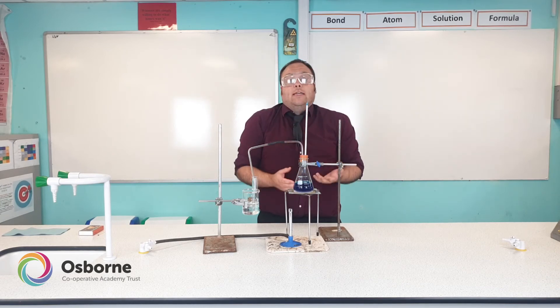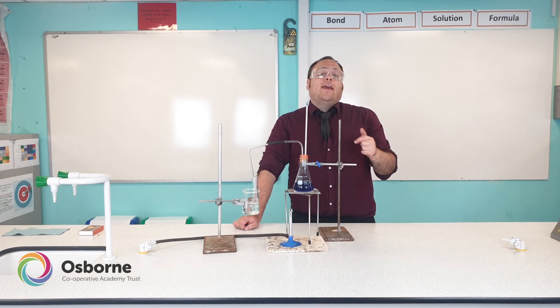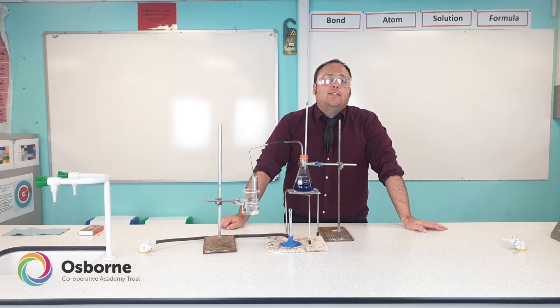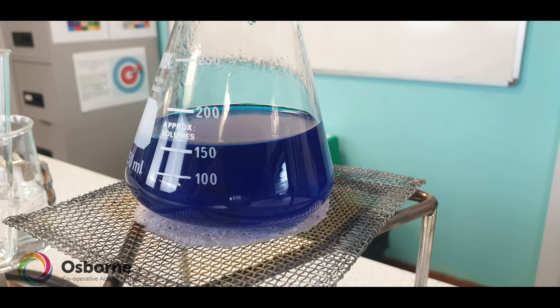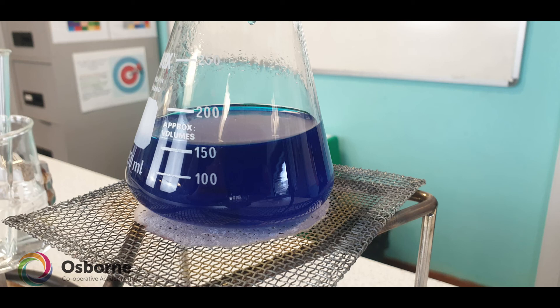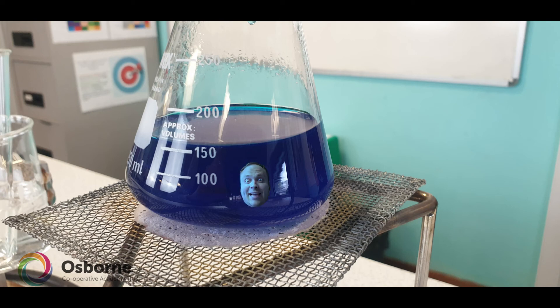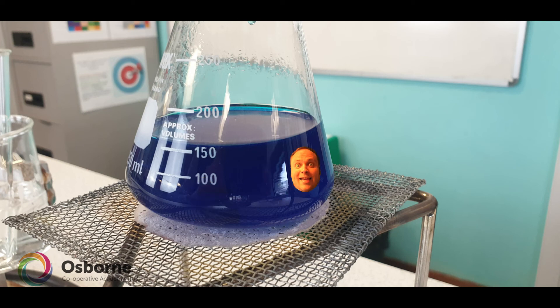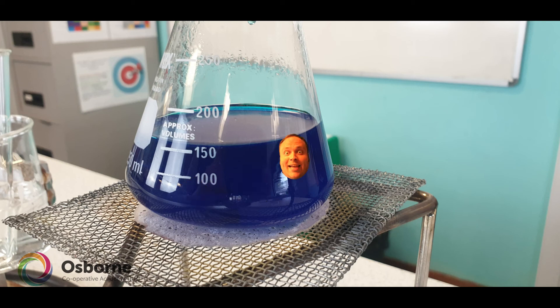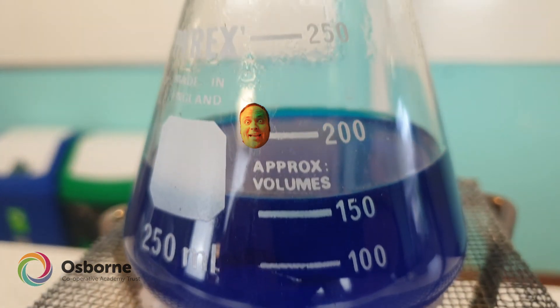Now you should know what distillation is and how to set up distillation using a Liebig condenser and also as part of the Core Practical. The final part is to know how distillation achieves this separation. Distillation uses the fact that different chemicals have different boiling points in order to separate them. In the case of ink and water, water has the lower boiling point, which is 100 degrees Celsius. Imagine you could see the molecules of ink and water in the flask being heated — there would be millions, but we'll focus on one single water molecule.